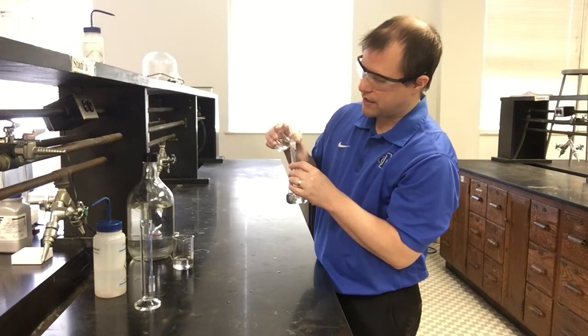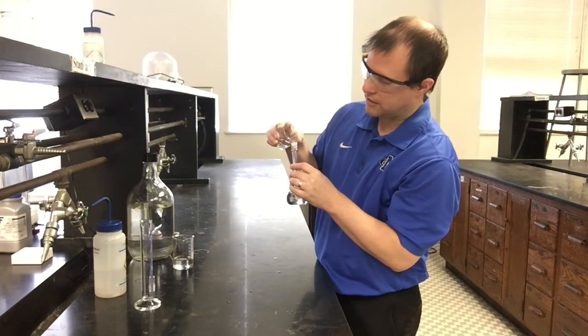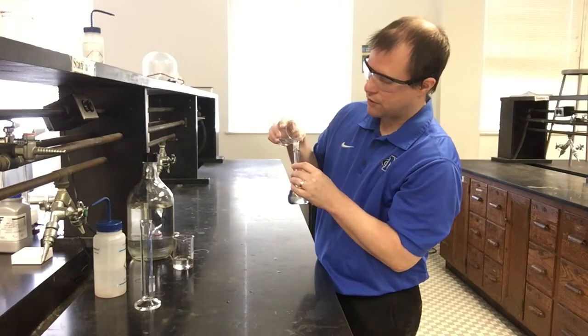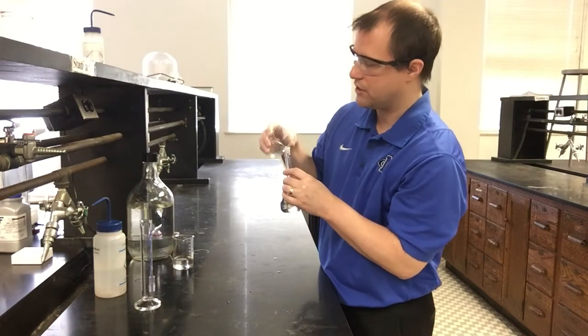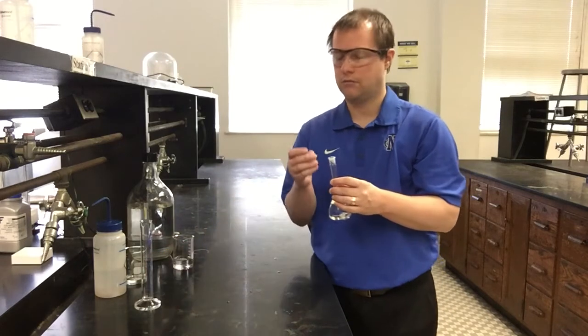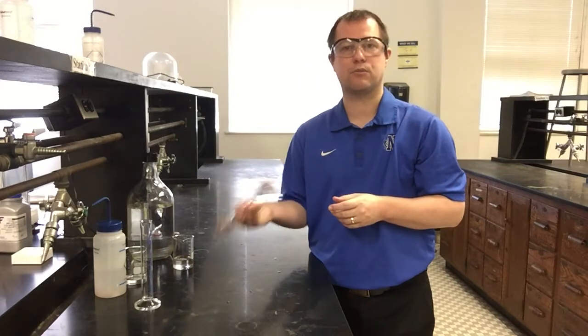Then I'm just going to mix everything up good again to make sure I have my solution nice and thoroughly mixed. And then I'll add the last little bit of water I need to get the right volume of everything. It might seem like this is kind of overkill on how you're prepping your solution, but these good habits do pay off, particularly as you get into reactions that are a little more particular, or things you have to be really accurate on, especially if you have very small concentrations. Taking these little extra steps really does matter.